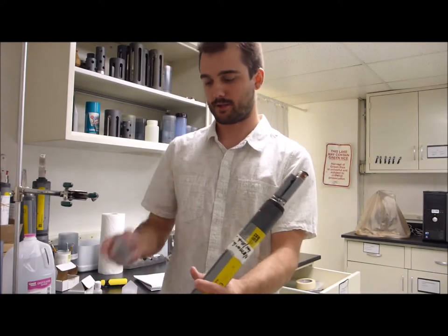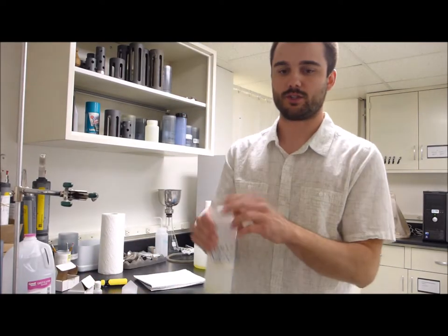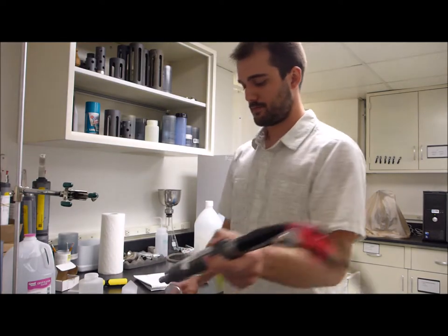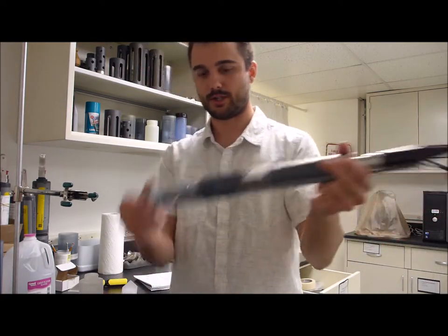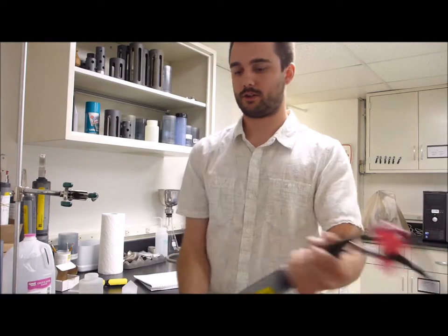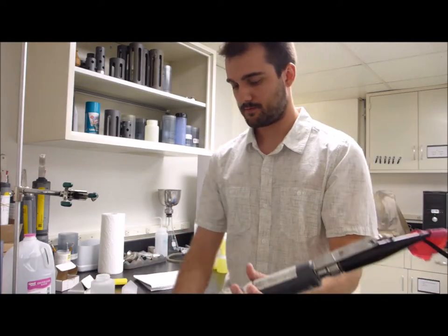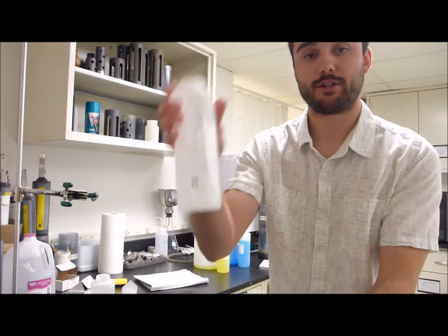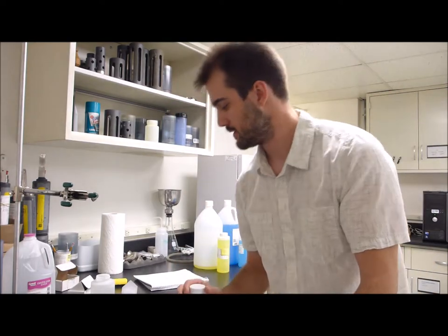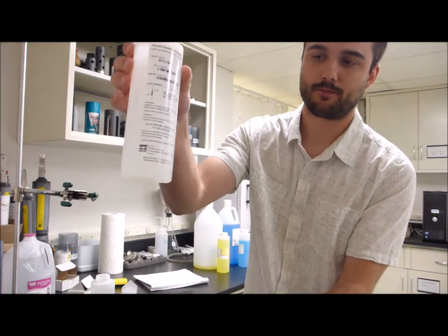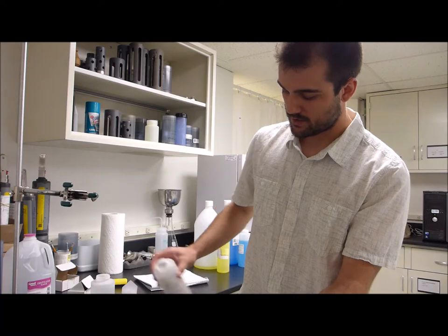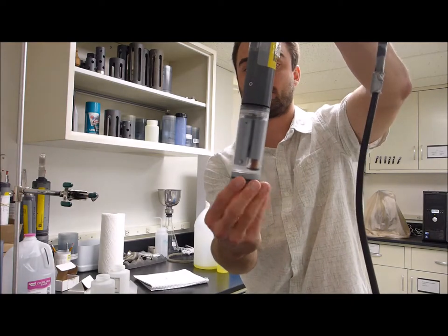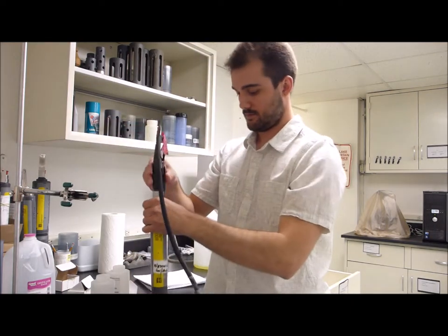What we're going to do is we've got our calibration cup. So this is a rinse, which is old calibration solution that we used to calibrate last time. Just need a little bit in here, we'll close it up, rotate it, invert it a few times. So we do two rinses with a rinse, then we'll actually do one rinse with the fresh solution that we'll use to calibrate it. Now comes a time where we're going to fill this calibration cup up a little bit fuller and put it on. So those probes are fully submerged in the solution, make sure that can stand up.